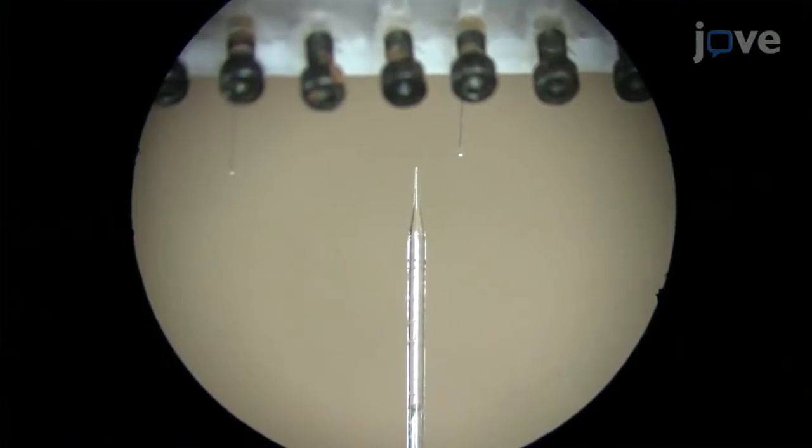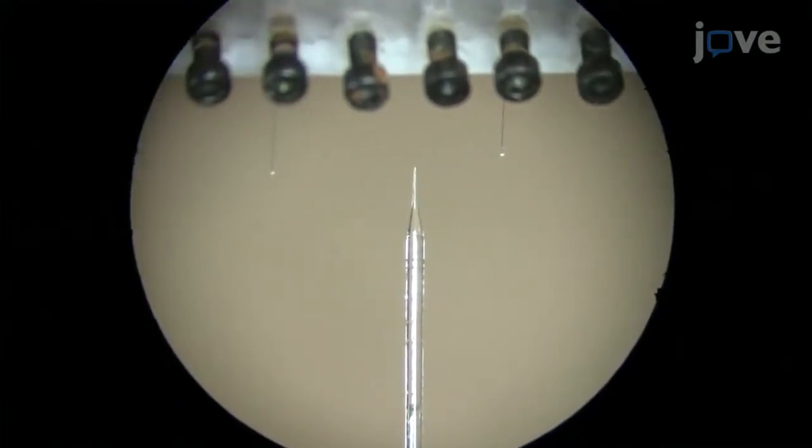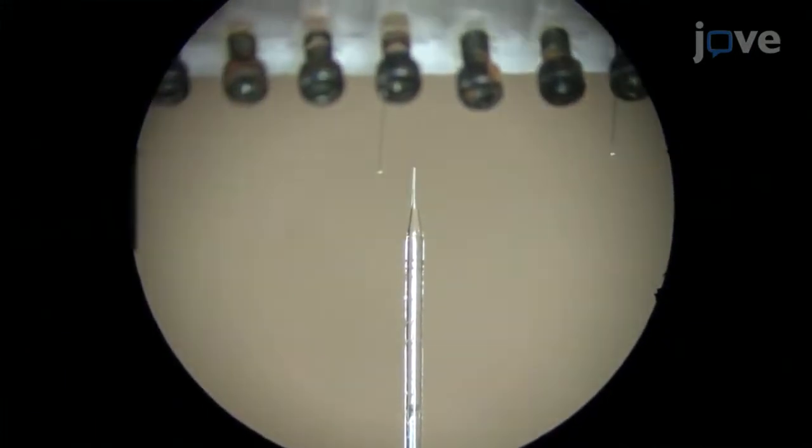When preparing multiple implants, apply the silk AAV solution to one implant and then move on to coat other implants before returning to the first.